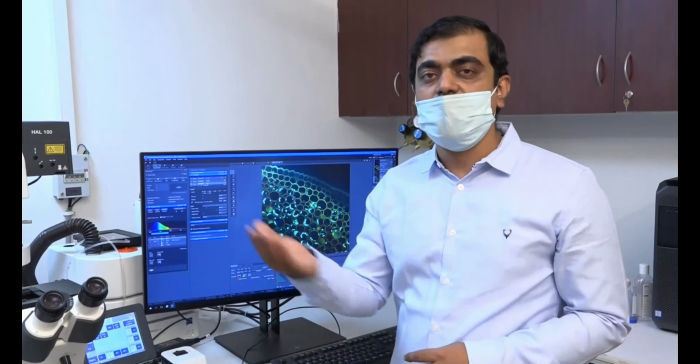See, the signal is getting lost. So I will mark this position. So the Z value is marked at this position, which is the start position here, the first one, and then I will go in the reverse direction so that I get to see my sample. So now I am back in the focus. Once I am back, I will move to the other side, stop the laser and set the parameter.